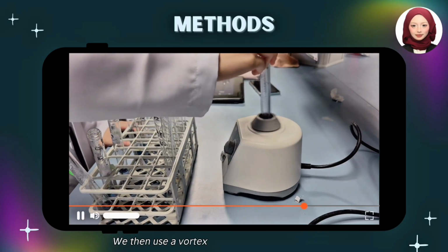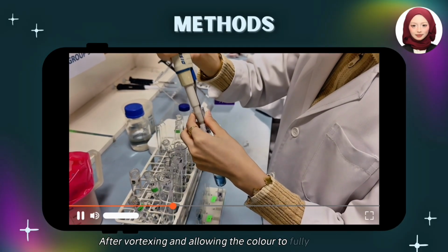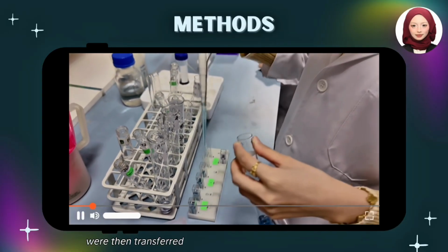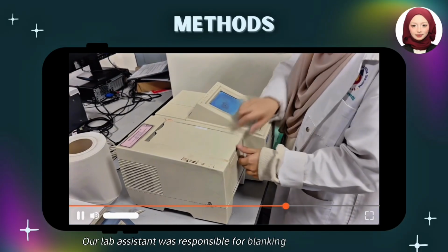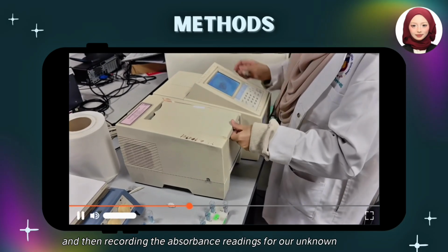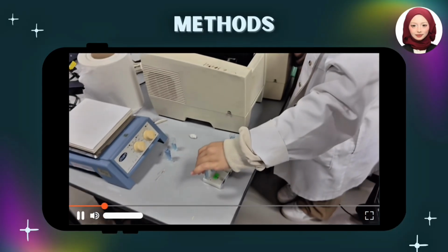We then used a vortex mixer to ensure the solutions were thoroughly and uniformly mixed. After vortexing and allowing the color to fully develop, the solution was carefully transferred into a clean cuvette. These prepared cuvettes, including the blank, were then transferred to the lab assistant for the final reading. Our lab assistant was responsible for blanking the spectrophotometer at 595 nanometers with a zero standard and then recording the absorbance readings for our unknown samples A, B, and C. These absorbance values were then used with the standard curve to estimate the final concentrations.